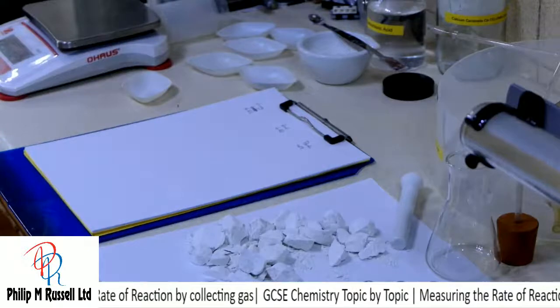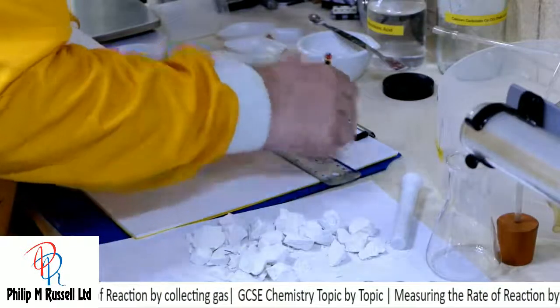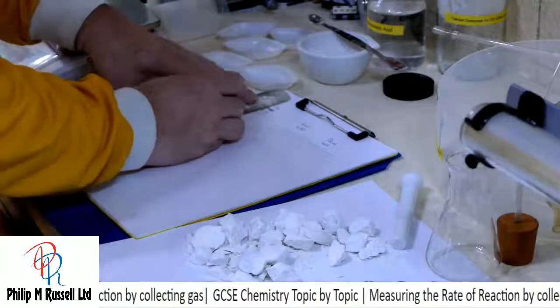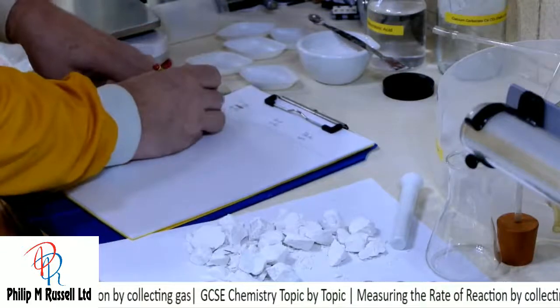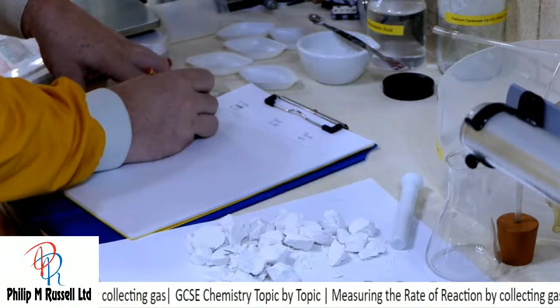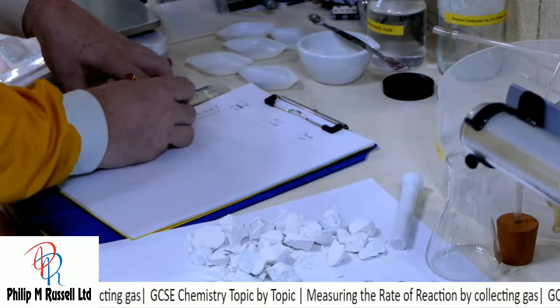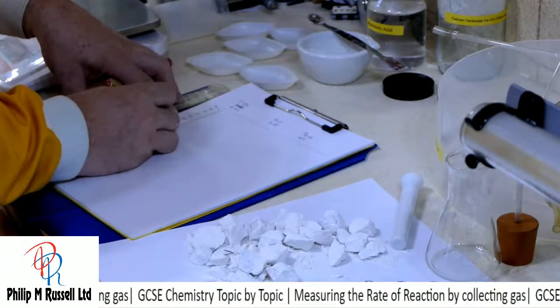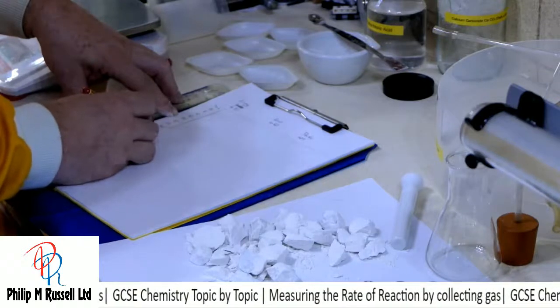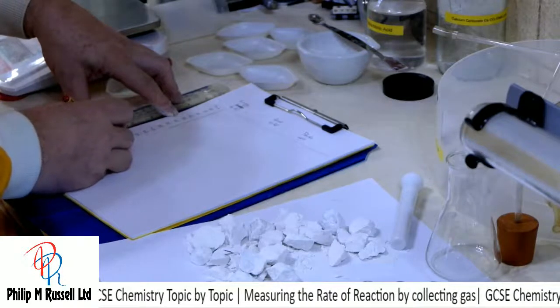So I've got my amounts. What I'm going to do is we're going to record in time and the volume. So I'm going to record down here time, and if we go about every 5 seconds, I'll make a little chart up, 45, 50, 55, 60.